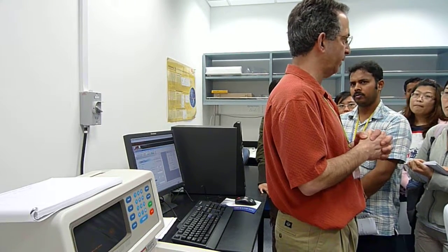That's why I'm doing this manual first set of scans, so that we can test that things look right, that everything's behaving right. Then we will set up the run and hope that things don't go wrong, particularly for new instruments. As I say, one of the machines that I use in our lab was actually a prototype that was donated to the facility when they were first building these. So they've really seen a lot of use.